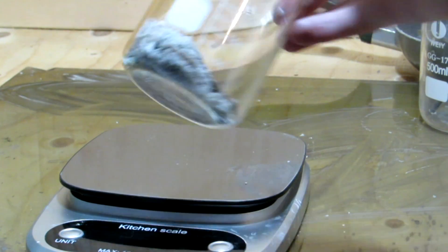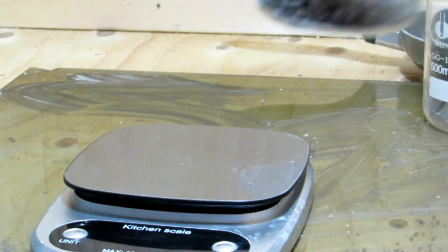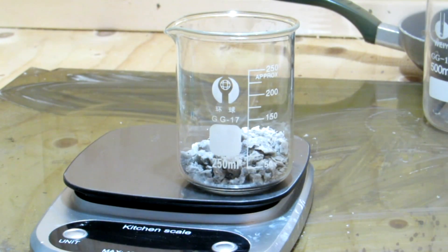In the end here we got 52 grams of our product, which corresponds to about a 53.7 percent yield. I did cut the expected yield in half because we lost half of our product. Overall this wasn't super efficient and I'm sure it could be improved a lot more, and I might be trying this in a future video again.